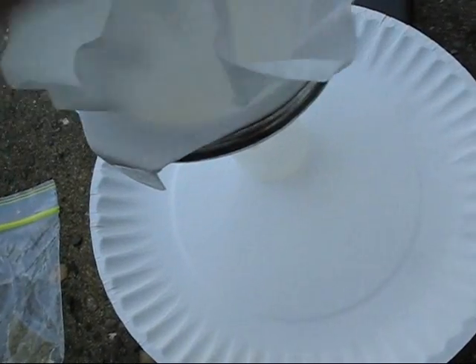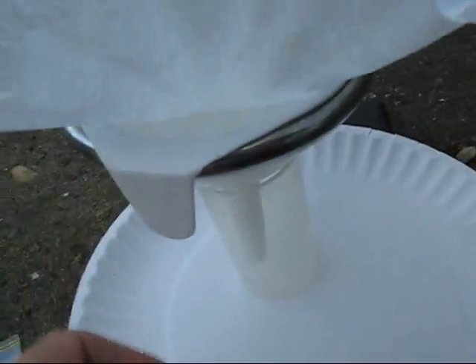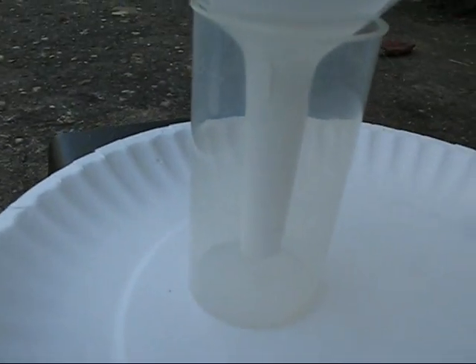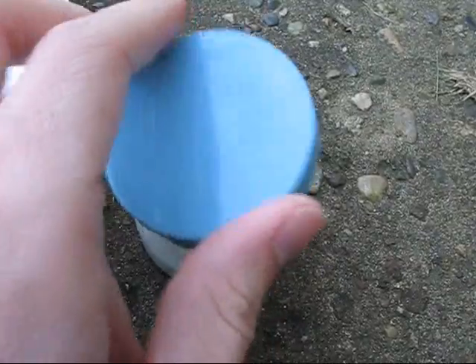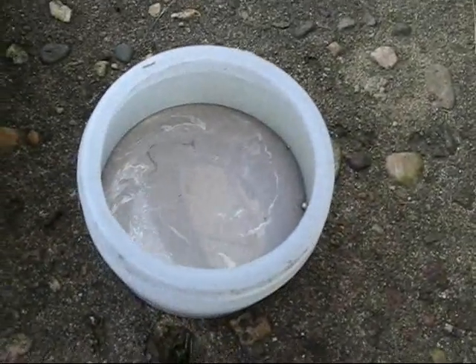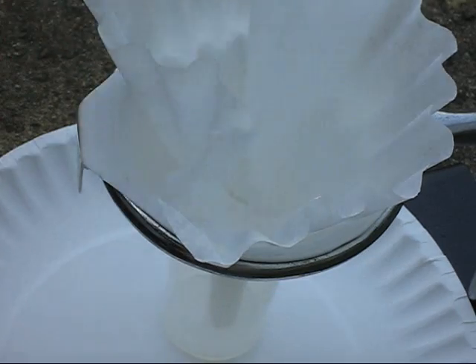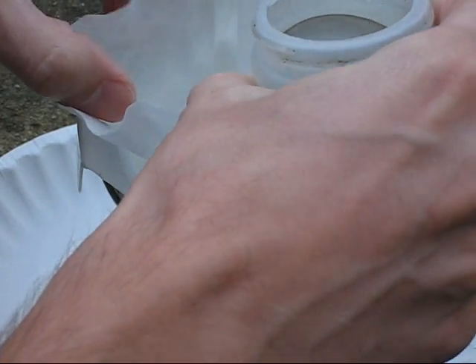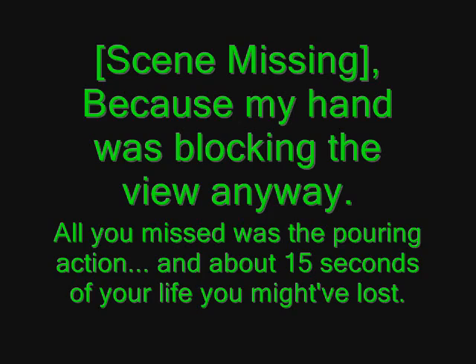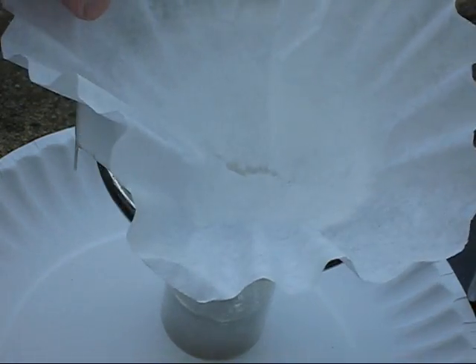Stuff that in. It doesn't want to stay down. I'm just going to have to deal with it. Container. I have the stem of the funnel as low as it goes, just to minimize splashing. You can see very dirty — it looks more like grey, muddy water than a metal. Let's just see what happens. Okay, I'm going to call this a failure.